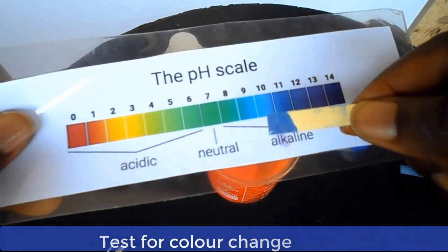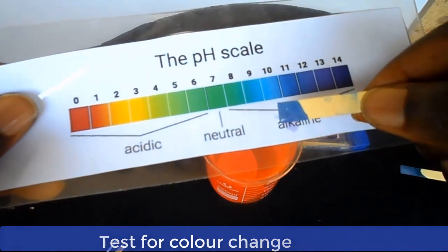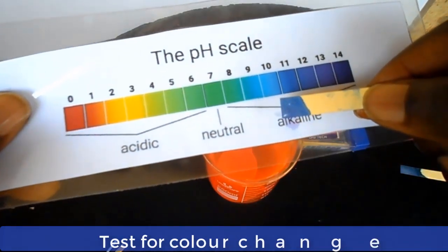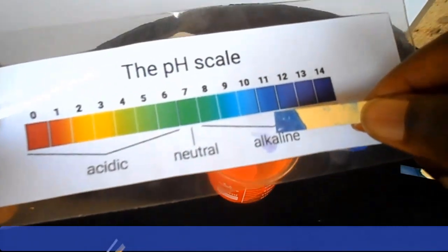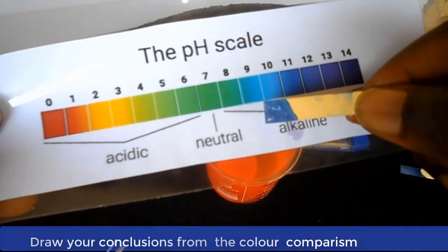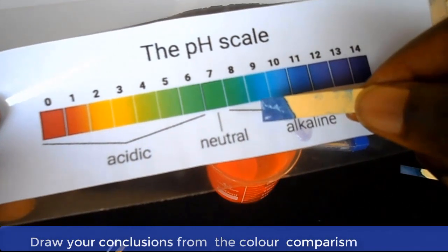From our observation and color comparison, it seems the pH of our soap solution is about 10.2. The blue color of the universal paper is more faded than the previous reading.